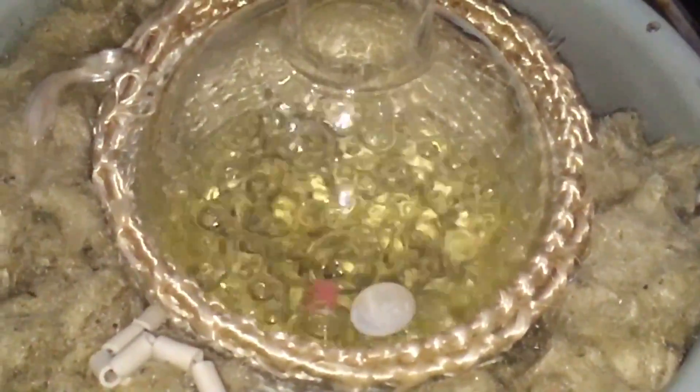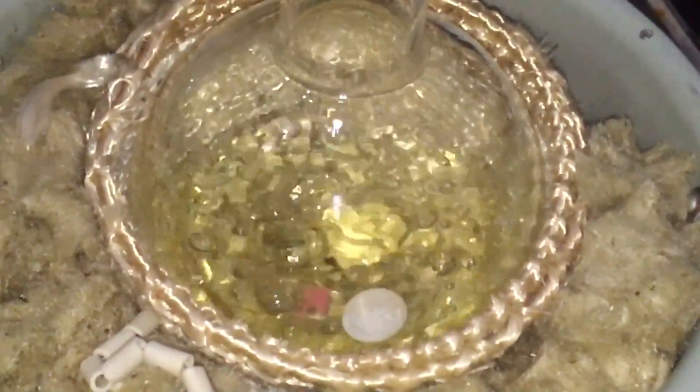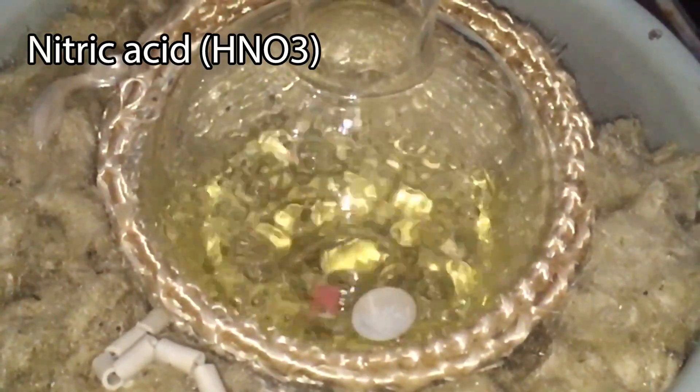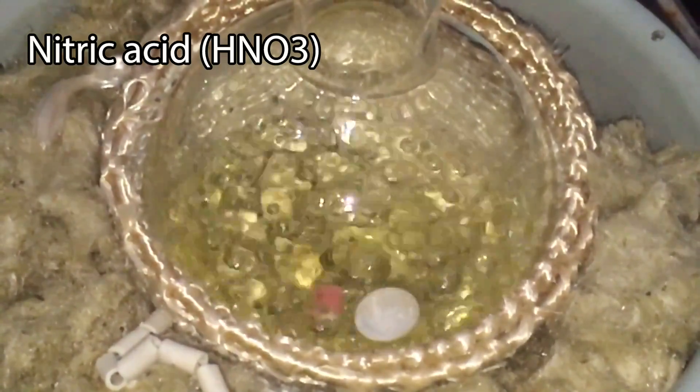Nitric acid is extremely useful and common in laboratory. It is one of the only acids that can dissolve metals like copper and silver alone. It is also a useful acid for organic reactions like nitration.